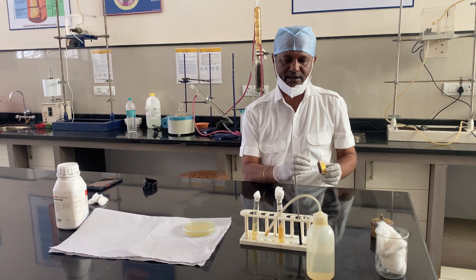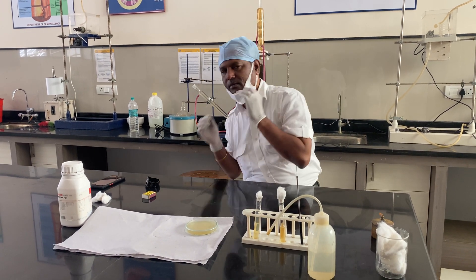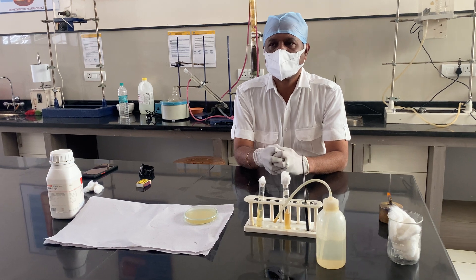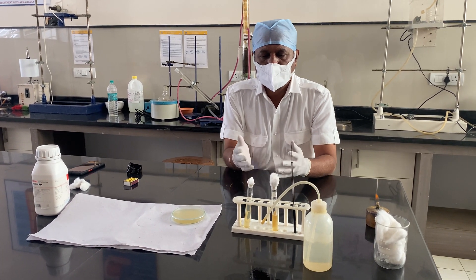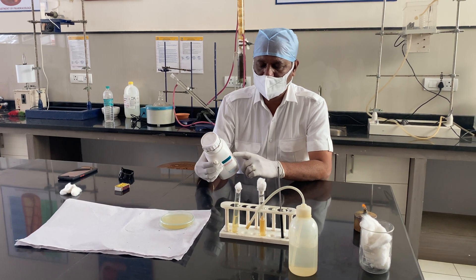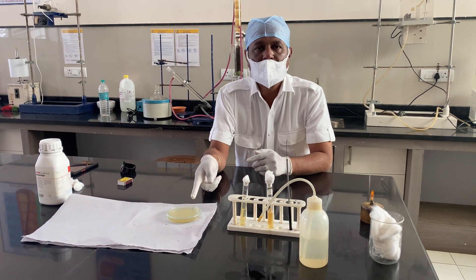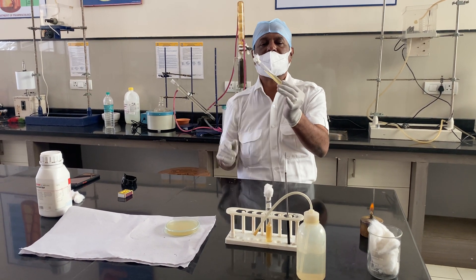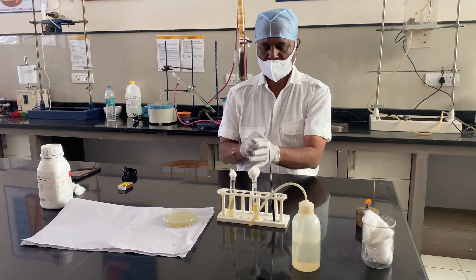This aseptic technique may be performed for sample transfer or for subculturing, either in test tubes with slants or in petri plates wherever the media is prepared. Today I have taken nutrient agar media, sterilized it, poured it into a petri plate, and allowed sufficient time for it to solidify. I have also prepared a slant, which you can see here.